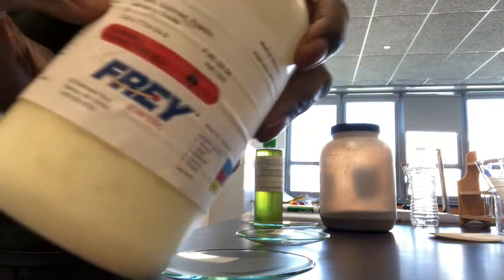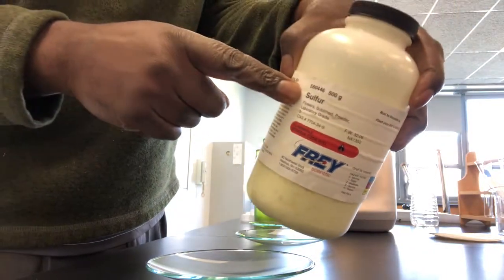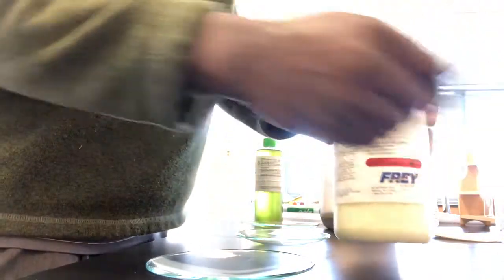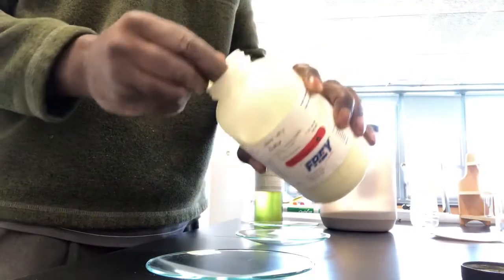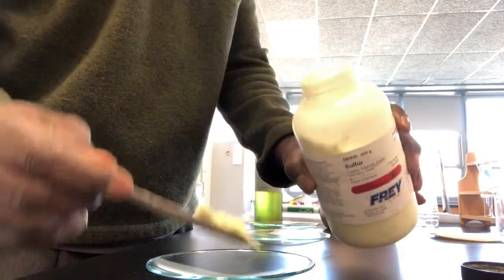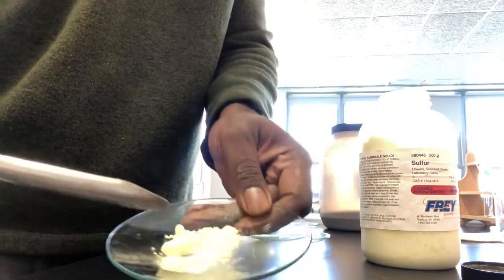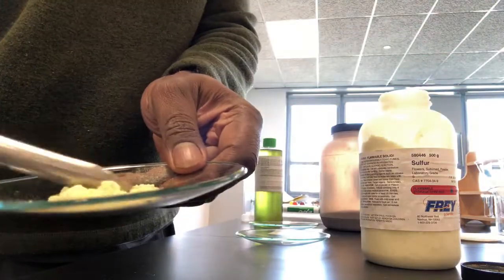Right here, we have sulfur — I don't know if you can see that or not. This is sulfur, and sulfur is an element that we discussed before. So if I take some sulfur and put it in my watch glass right here, I'll show it to you. See? It's an element — a yellow powdery substance.